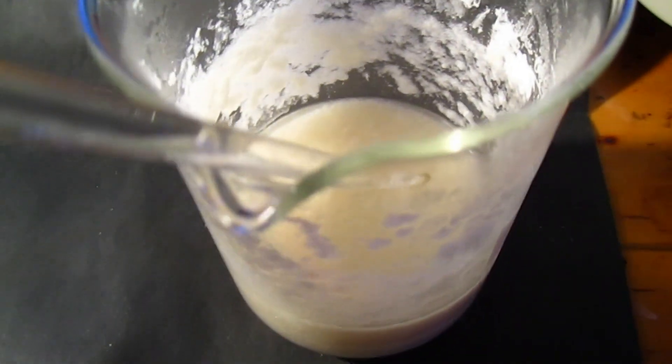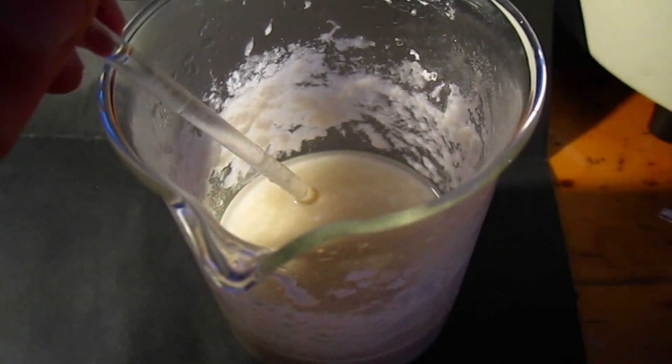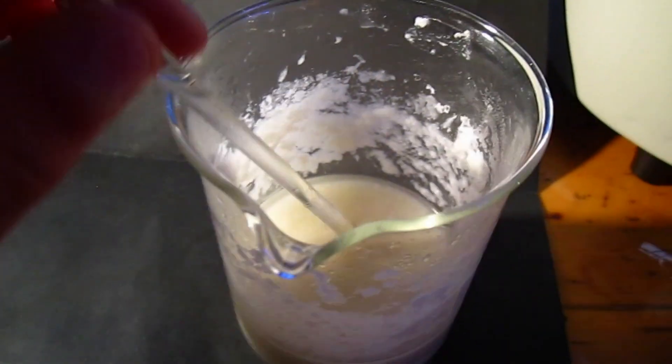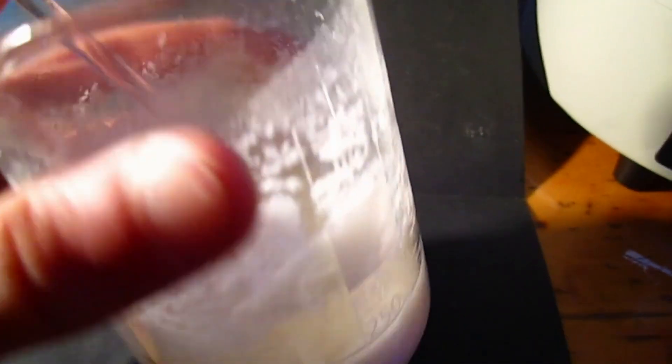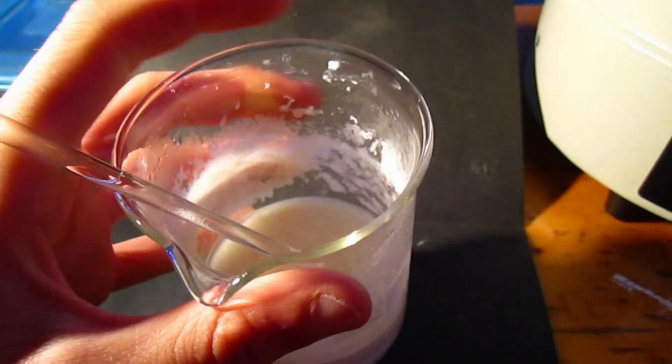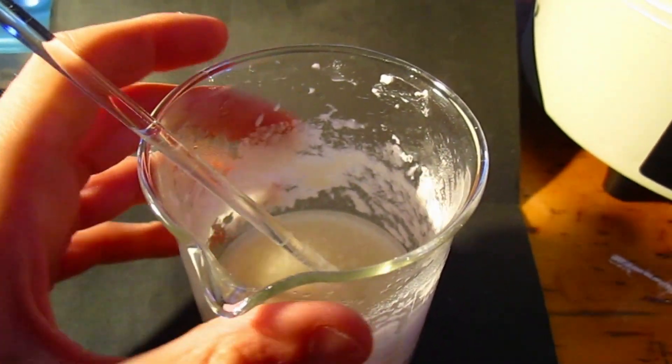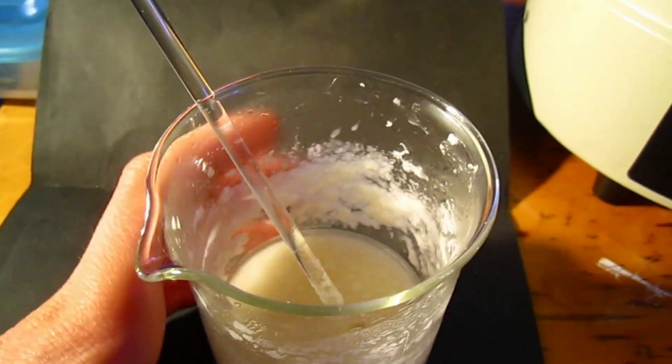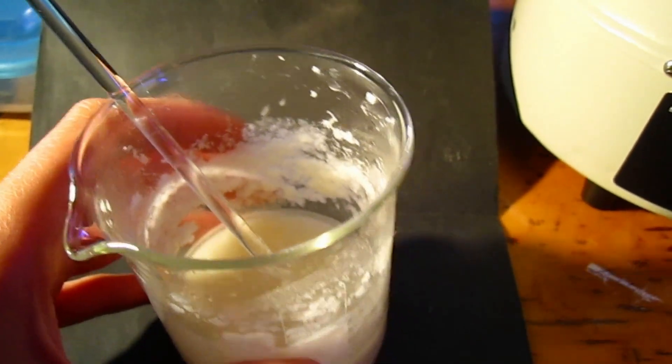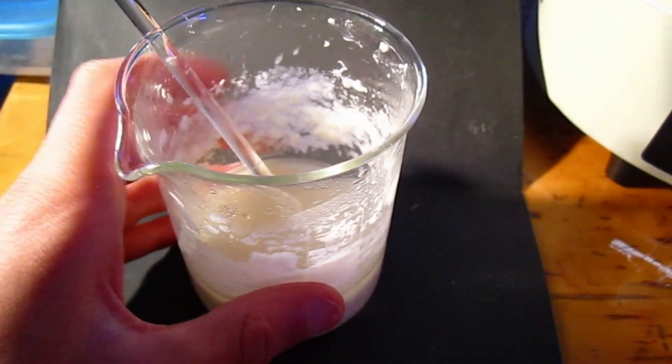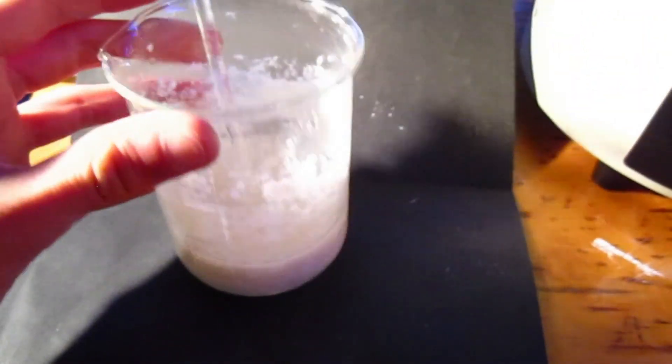I'll probably set it outside to cool down. It's like four degrees outside, so it will precipitate out more crystals and then we're going to filter it and dry it and maybe recrystallize a second time. I think it's going to be pure enough. I actually wonder what were the 20% of impurities in this product.